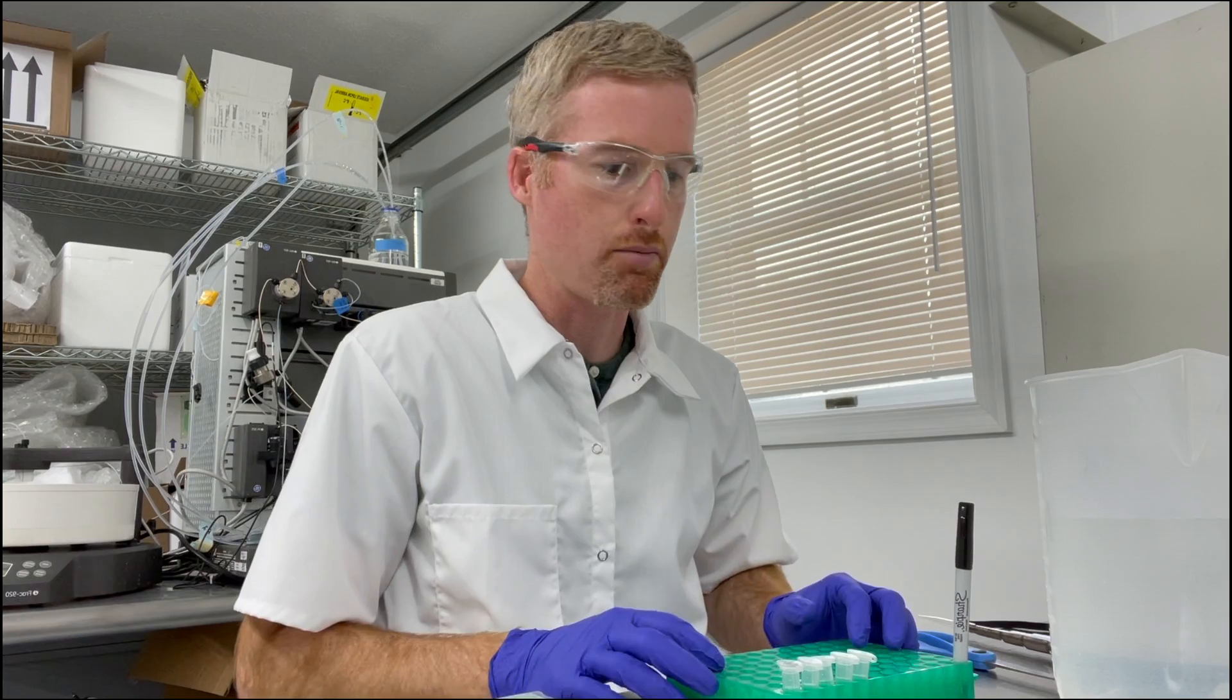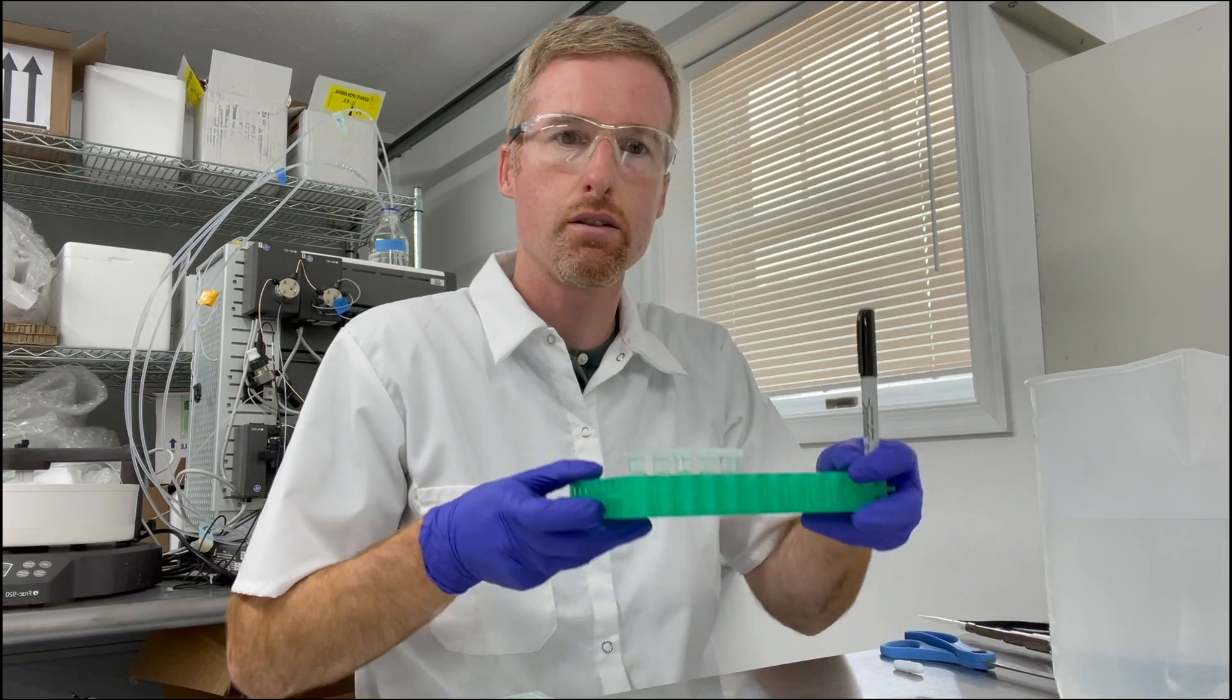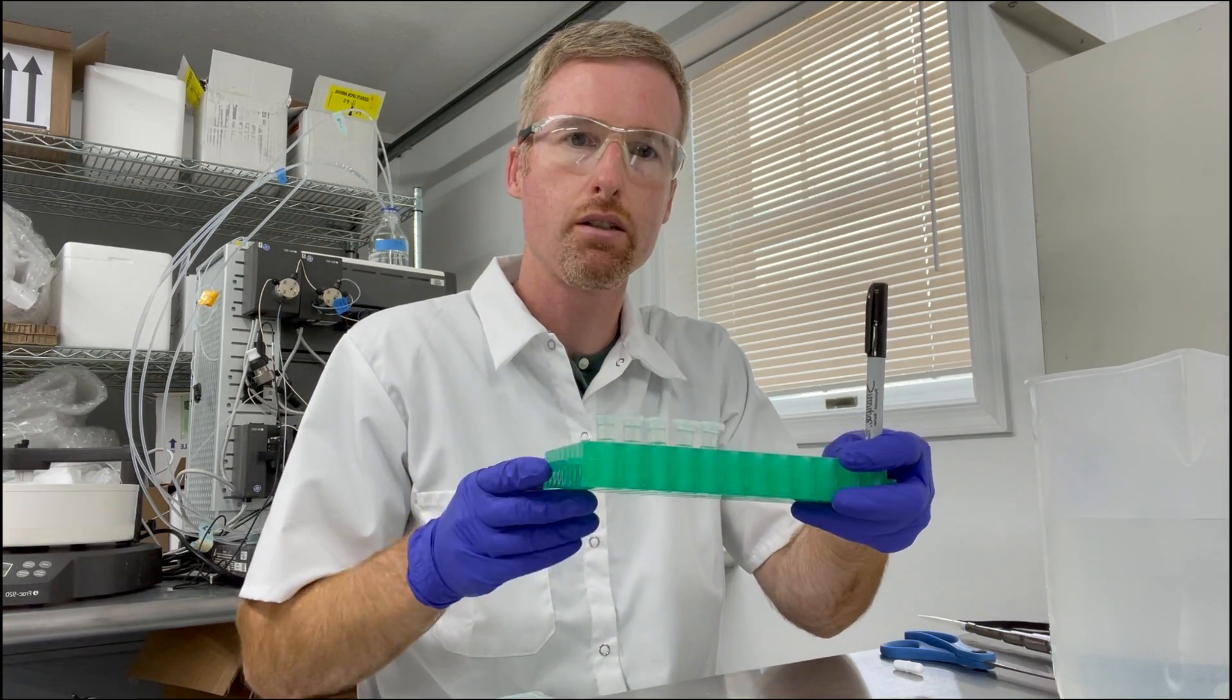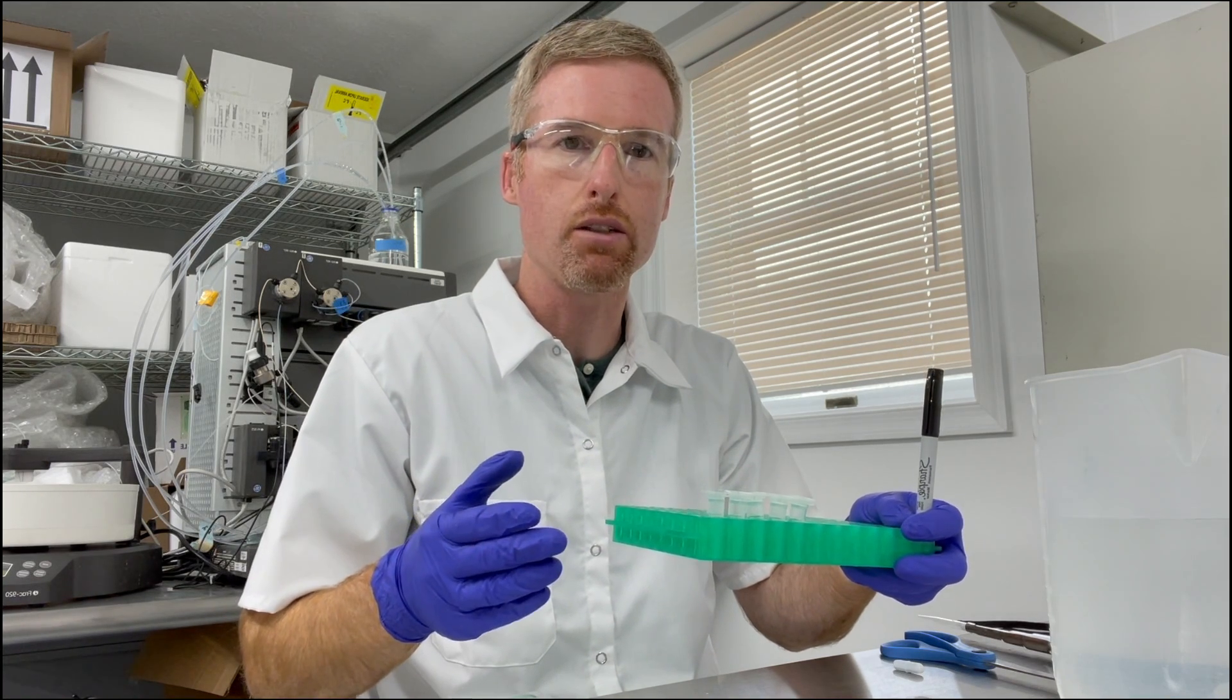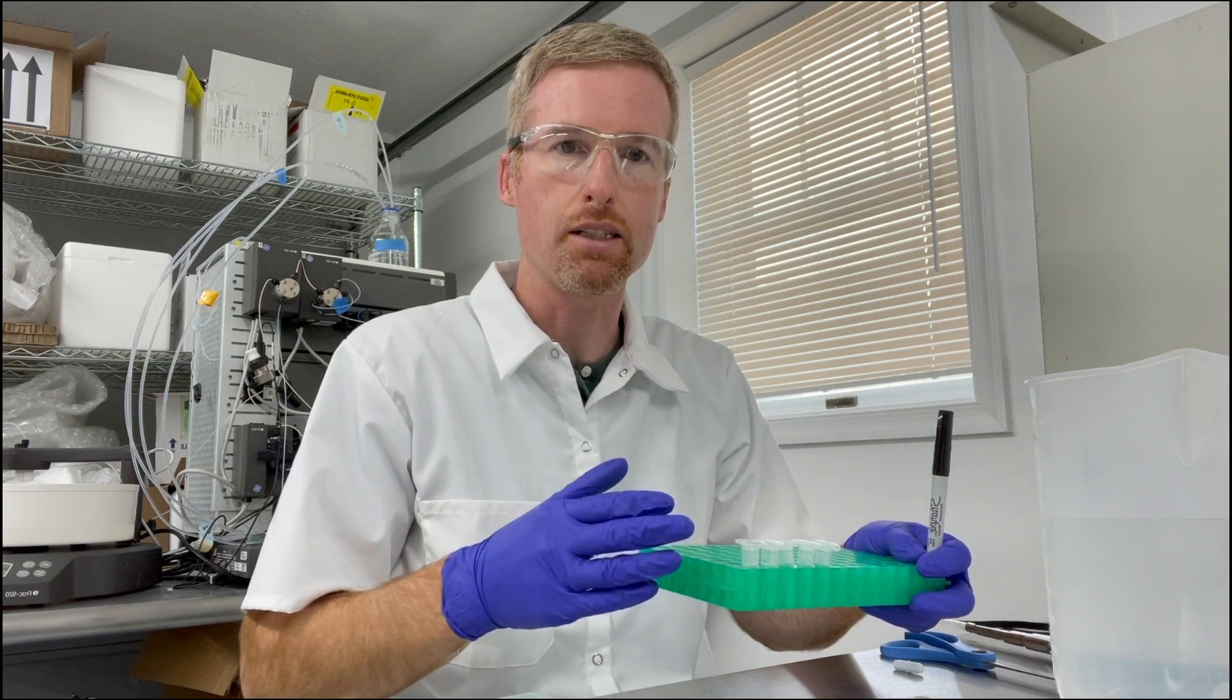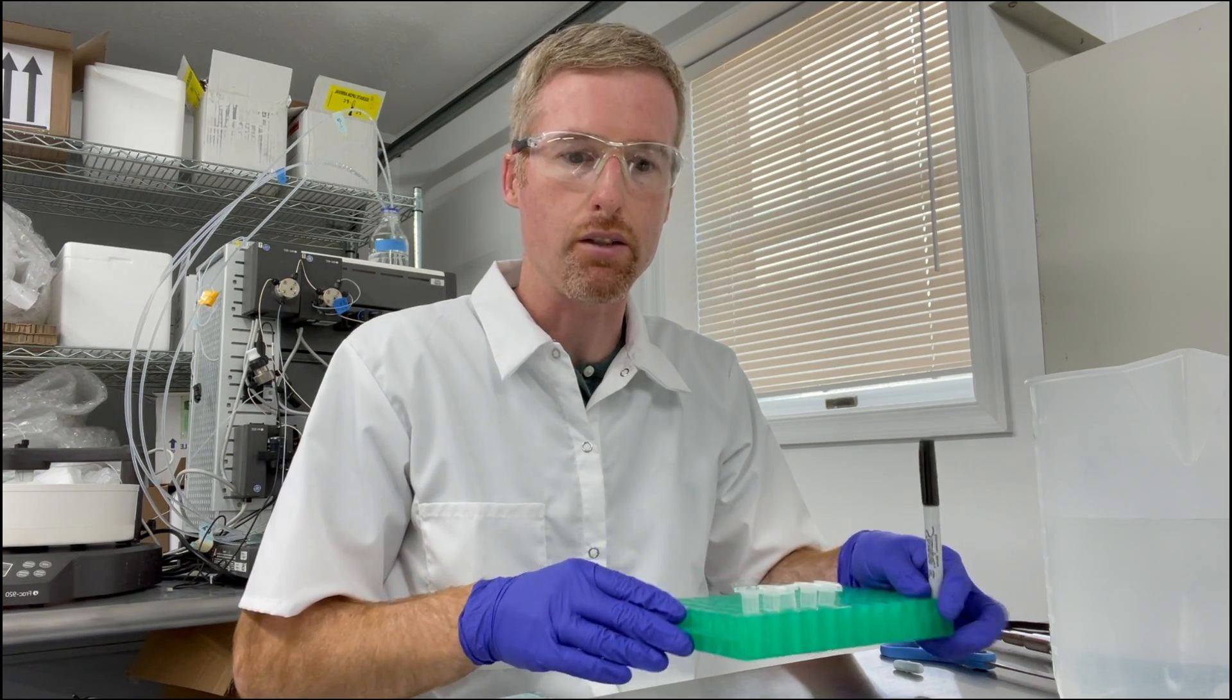Hello, Jonathan Wagner here from SolidZymes.com and today I'm going to show you how to dialyze a protein. So what I've got here is some protein fractions that I just eluted from nickel agarose. They have a lot of imidazole in them so I want to dialyze them into a new buffer without imidazole.